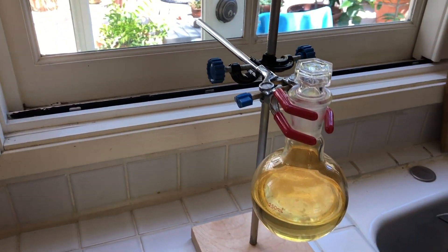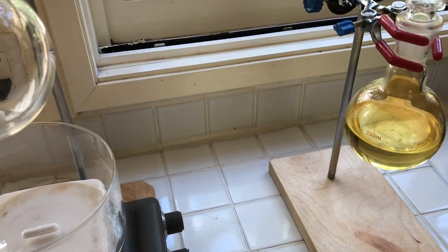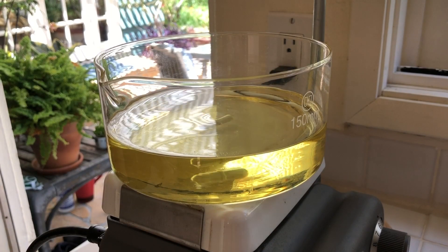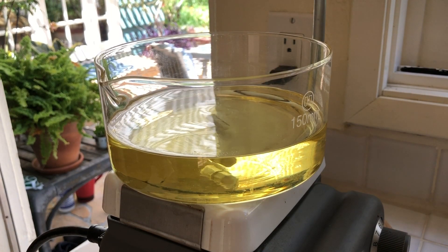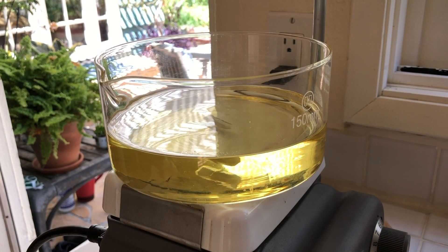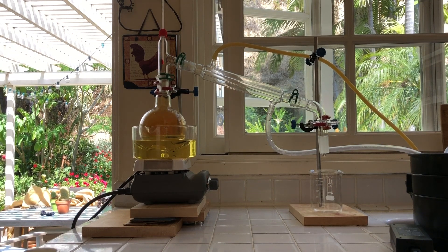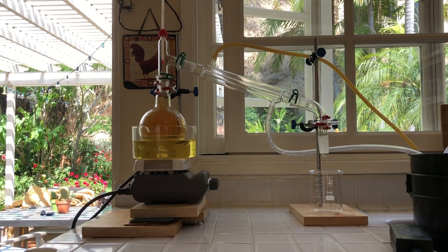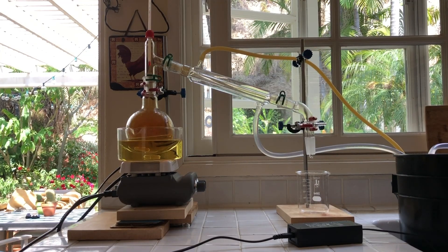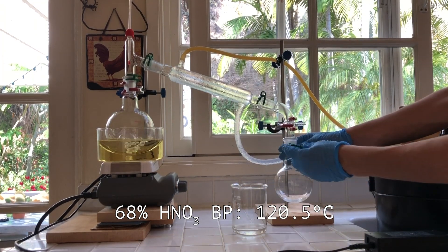Now it was time to re-distill. However, I didn't have another 250 ml receiving flask, and I didn't want to collect in a big 500 ml flask, so I just transferred the contents and washed the flasks. At this point, an order of glassware came in the mail, and I was excited to try it out, so I put oil in my new crystallizing dish and began preheating it for an oil bath. Then I set up for distillation, using a beaker to collect the fore run. Since the apparatus was opened for the beaker and a tube leading outside wouldn't be effective, I set up a big fan off-screen blowing from behind me and out the window. When the temperature reached 118, I swapped the flask.